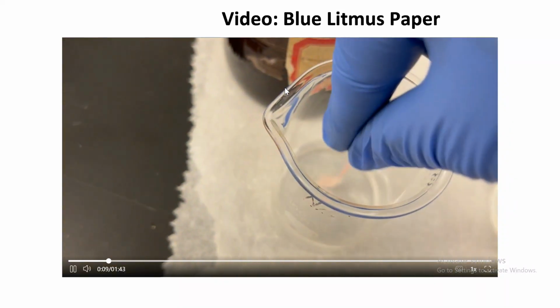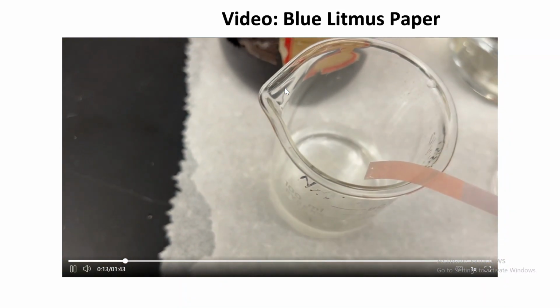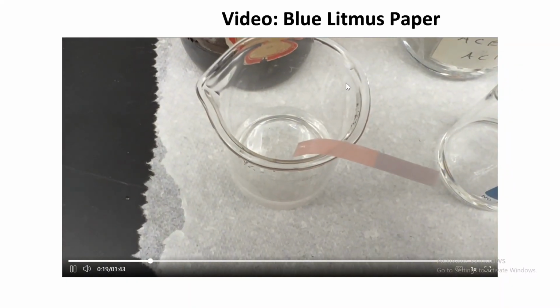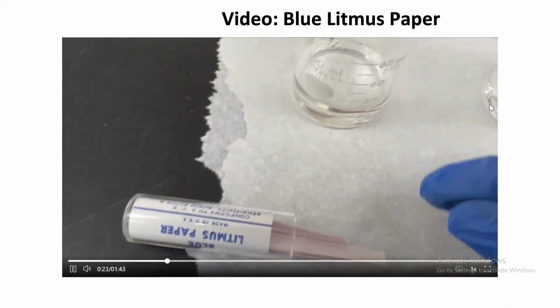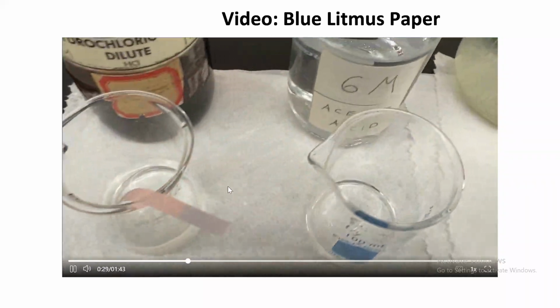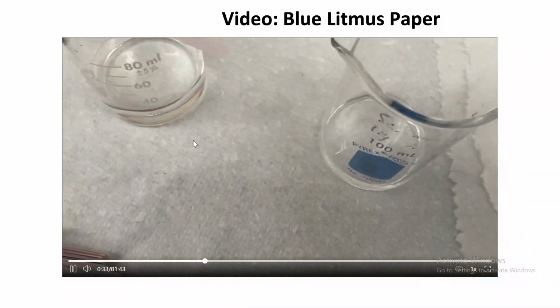We're going to dip it in the acid and notice the color. Here's the color right here, so we're focusing on it.